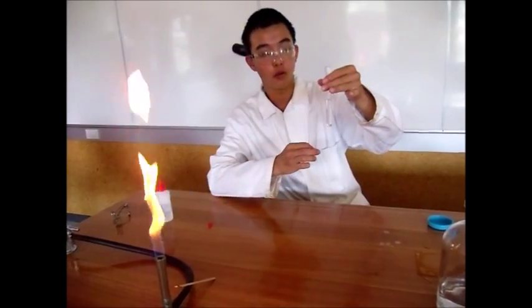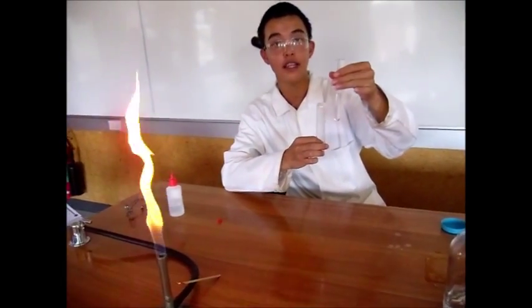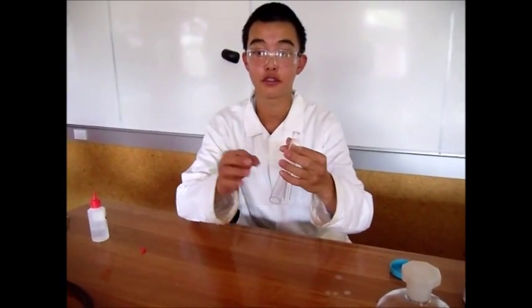Hello. Today we will be investigating the reaction between hydrogen and oxygen. Firstly, I've got some 1 mole per litre hydrochloric acid here, and also I've got some magnesium strips.